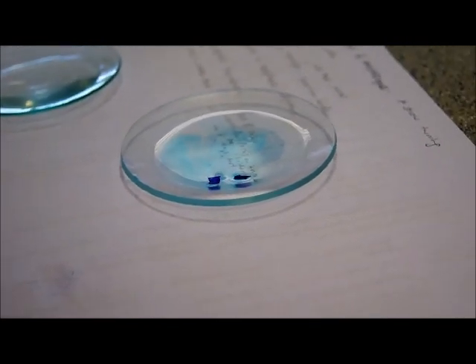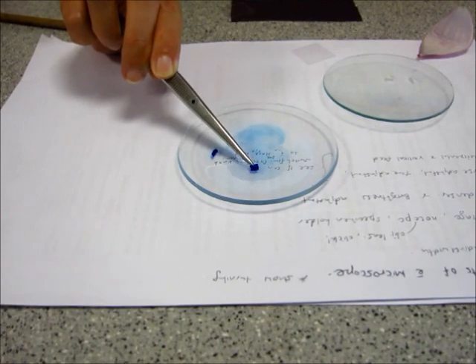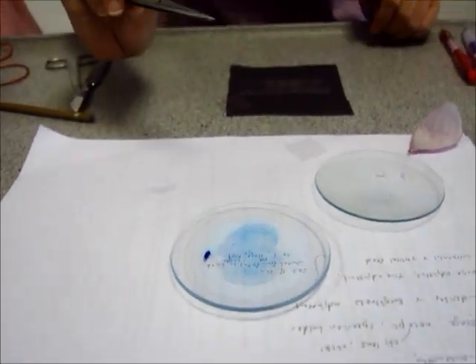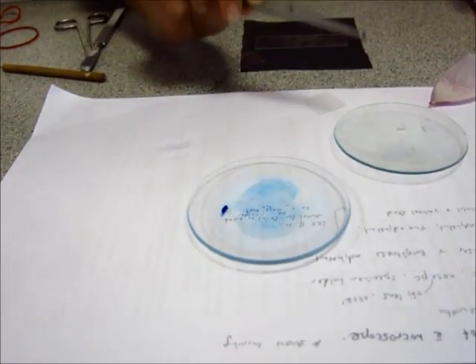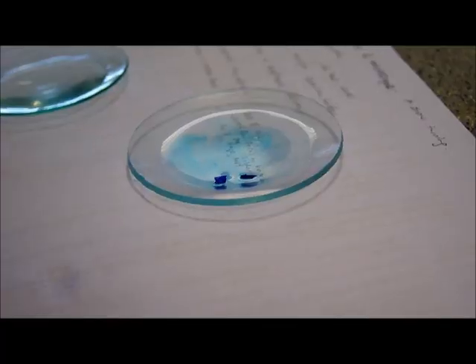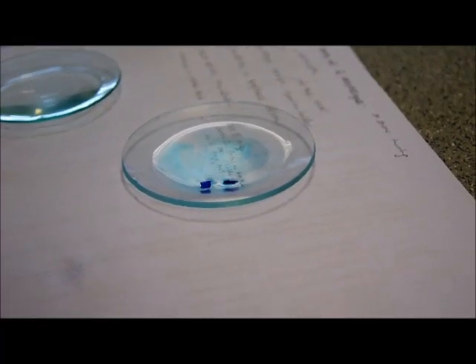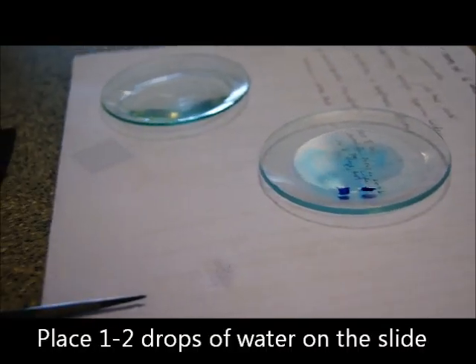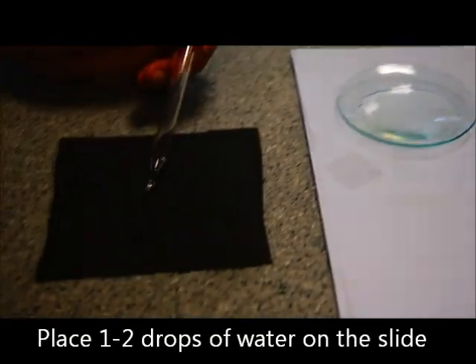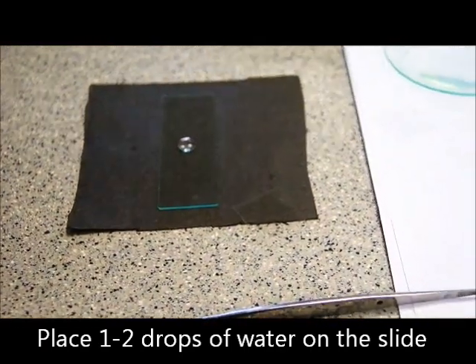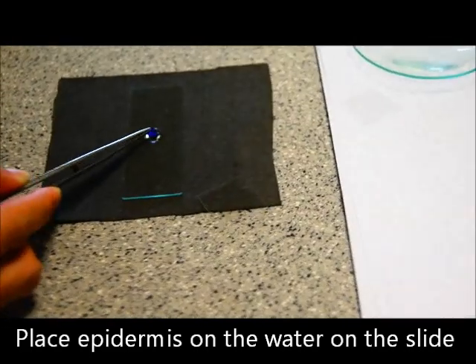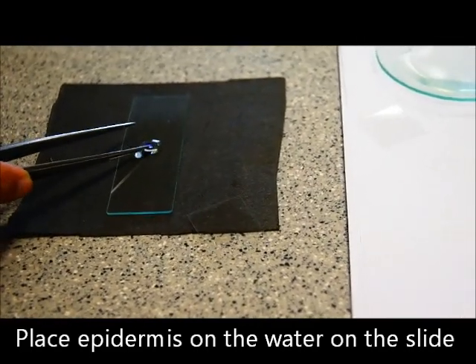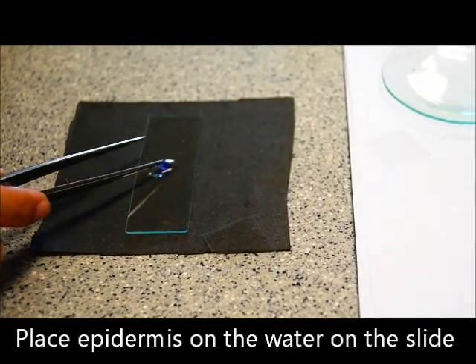After the epidermis has been washed in the water for a couple of minutes, now we can start with the mounting of the specimen. For the purpose of this demo, I will just show you the demo with the epidermis that has been stained. But basically, you do the same thing even with the epidermis that hasn't been stained. First, what we do is that we introduce a drop of water onto our slide here. We just put a small drop of water in the middle of the slide. And next, we pick the epidermis and place it on top of the water.